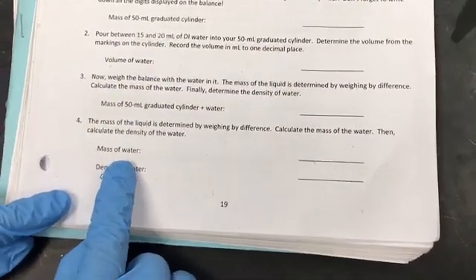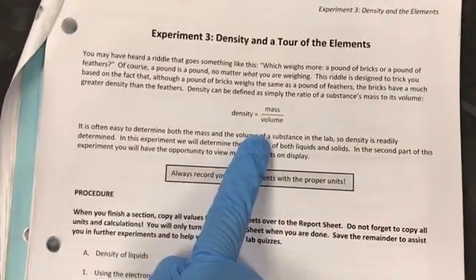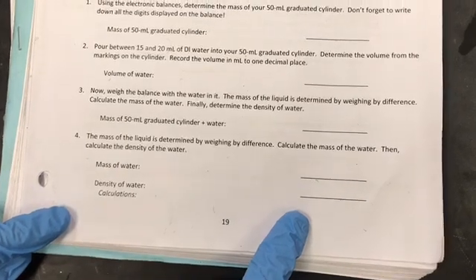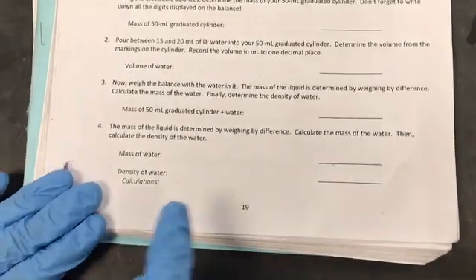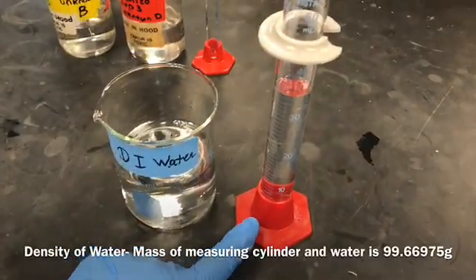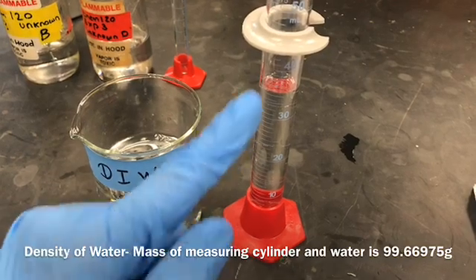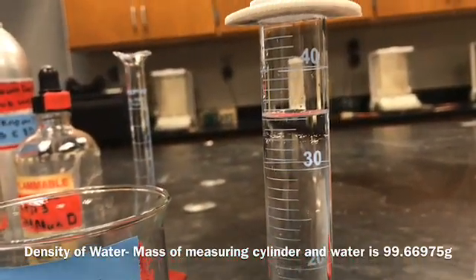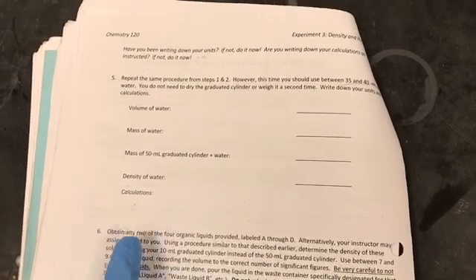You are going to determine the mass of water by weighing by difference. Then calculate the density of water using the formula mass divided by volume. We already determined the mass and the volume, so apply the formula to get the density. Make sure to watch your significant digits. It's always good to have the calculations written down — this page will not be graded, but it helps you catch mistakes. For the second trial, I added about 35 milliliters of water using the same measuring cylinder, so I did not weigh it again. Note down the volume reading for the second trial and determine the density the same way.